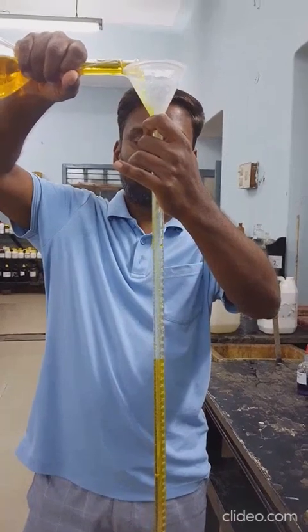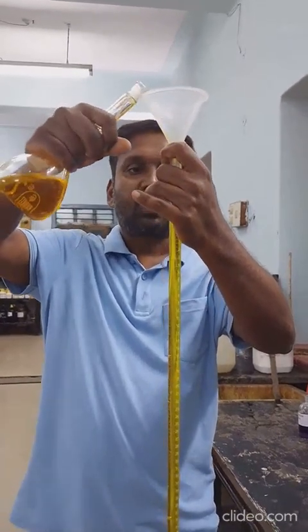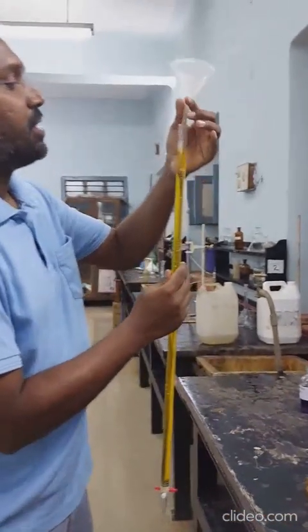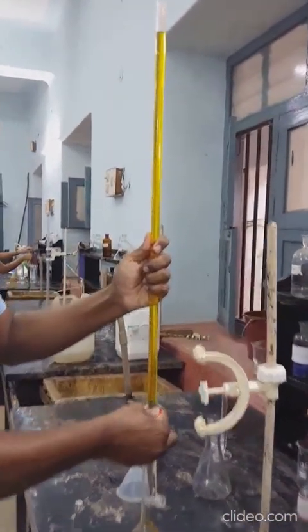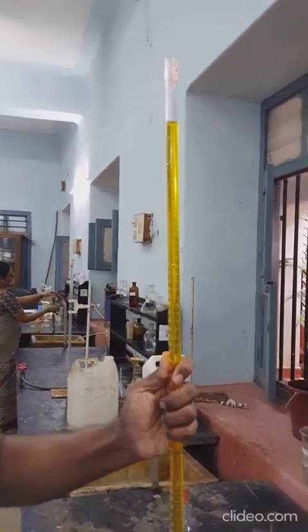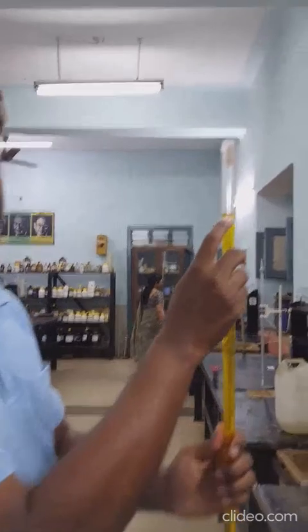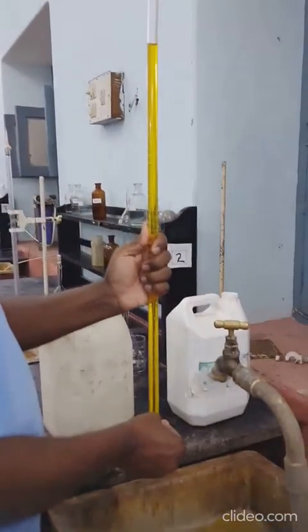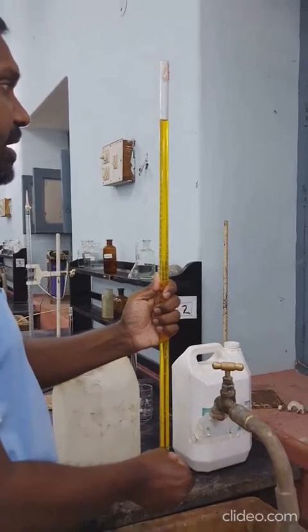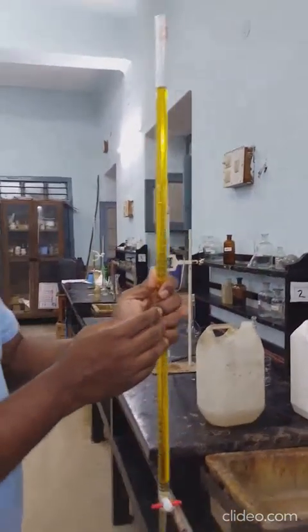The full volume should be filled up. It is quite possible that while pouring the solution, the volume can go over the 0 ml mark. Now you can adjust the meniscus exactly to 0. Once it is quite close to 0, bring the burette to your eye level and dropwise the solution should be run down and accurately the mark should be adjusted. The lower meniscus for dilute solutions should always be taken as your reference.